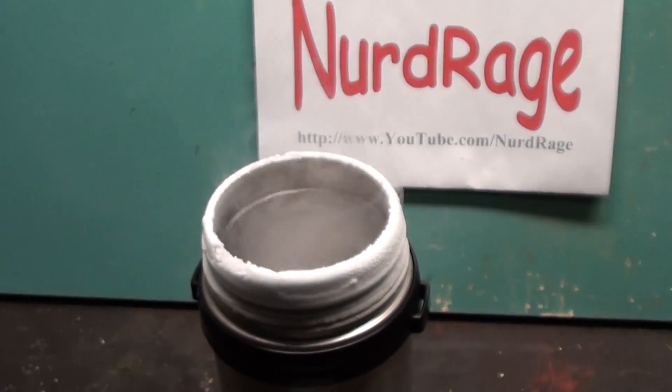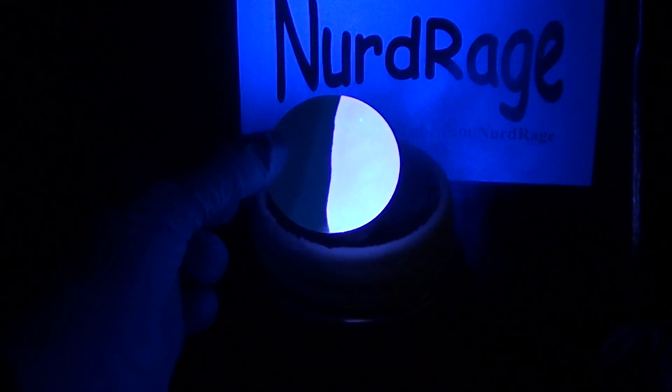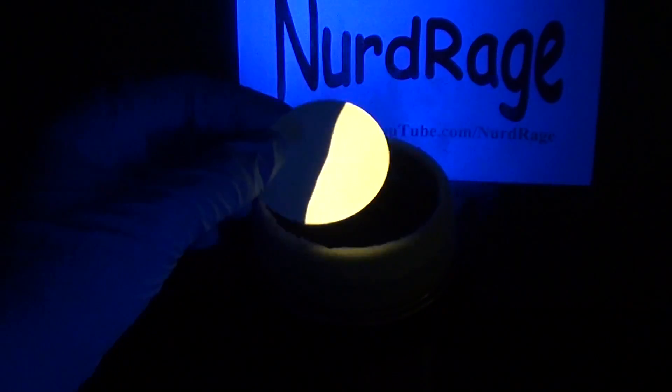This mono-pyridine copper iodide has a brilliant yellow fluorescence. The most amazing thing about this substance is that it changes color when cooled to liquid nitrogen temperature. Now look at that — it now has a nice purple-blue fluorescence. And as I hold it, it'll convert back to yellow as it warms up.